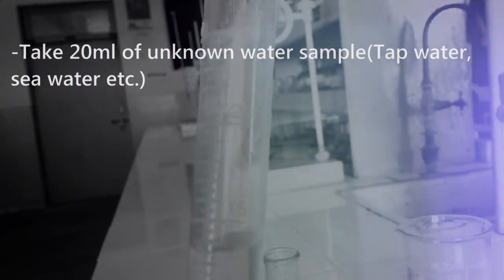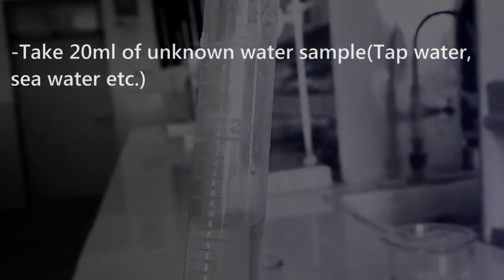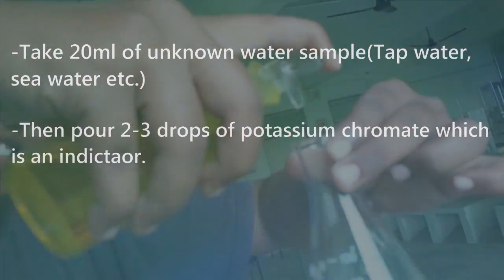Take 20 ml of unknown water sample which you want to test. It can be tap water, sea water, or the sample your lab instructor gives you.